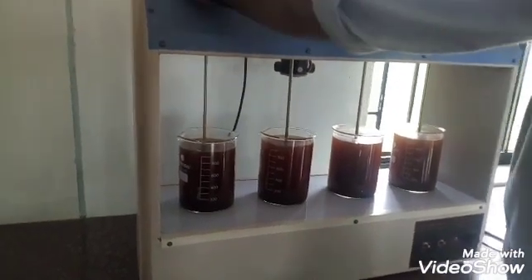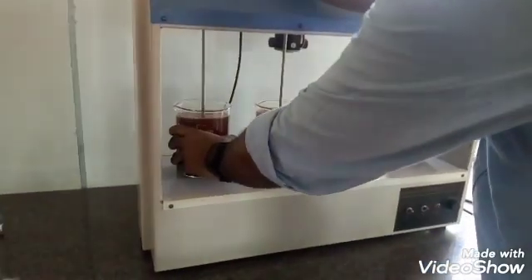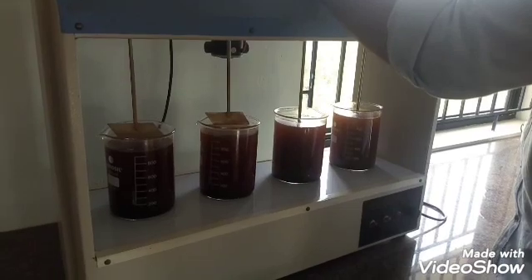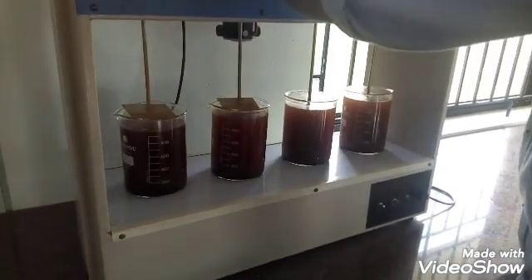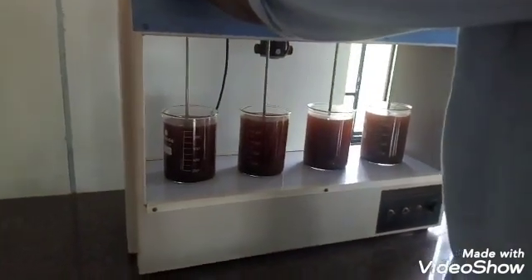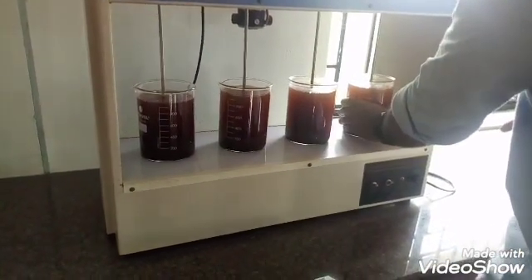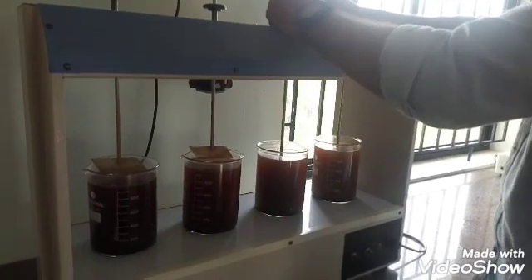We use 4 jars with synthetic wastewater. Samples are collected in 500 mL jars. We used sodium hydroxide to maintain the pH. We used a coagulant in this procedure.